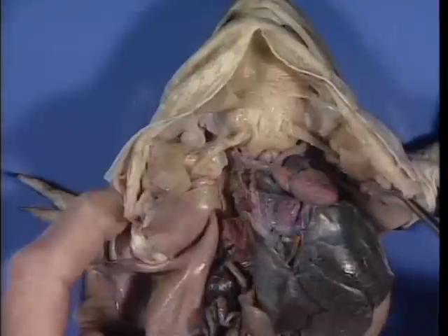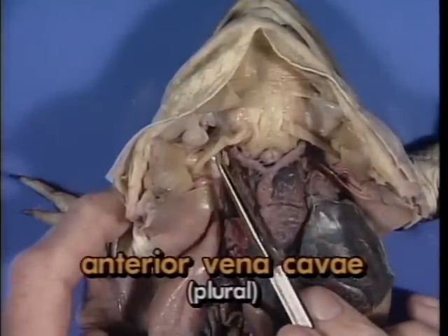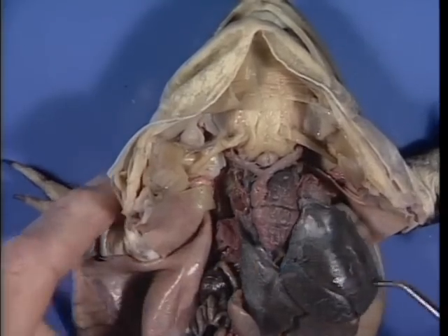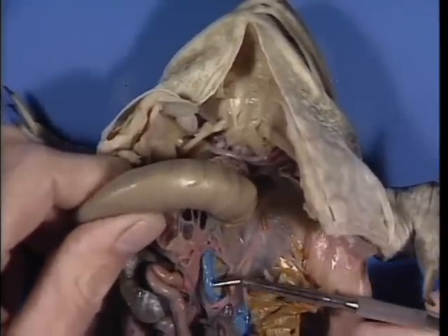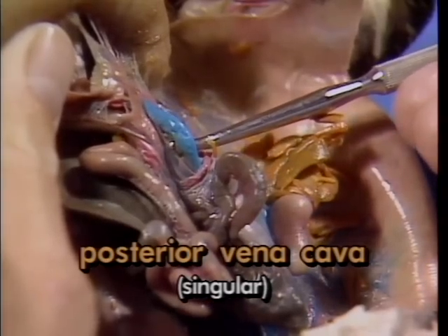From the head region, there are paired anterior vena cavae, here and here. The third vessel, the posterior vena cava, collects blood from the rest of the body.